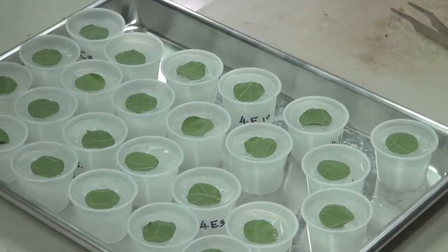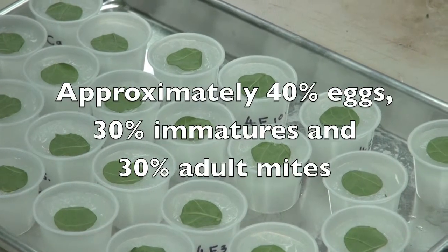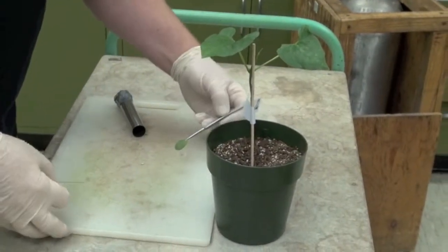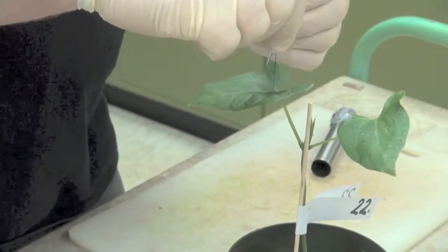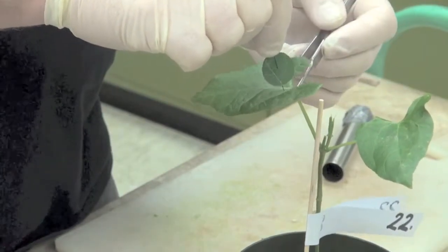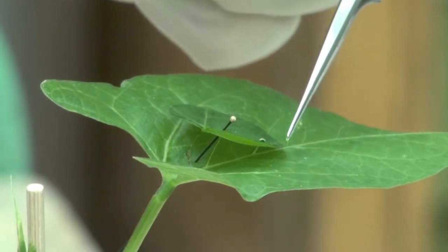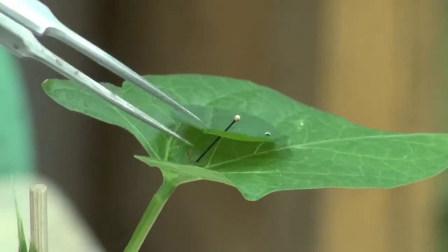By the start of week 3, all mite groups have been transferred to the smaller leaf discs. The next step is to pin one leaf disc containing our mite populations onto each leaf of the Mesocosm plant. The leaf disc should be pinned with the underside of the disc facing down, and with one edge of the disc in contact with the upper surface of the leaf from the bioassay plant.